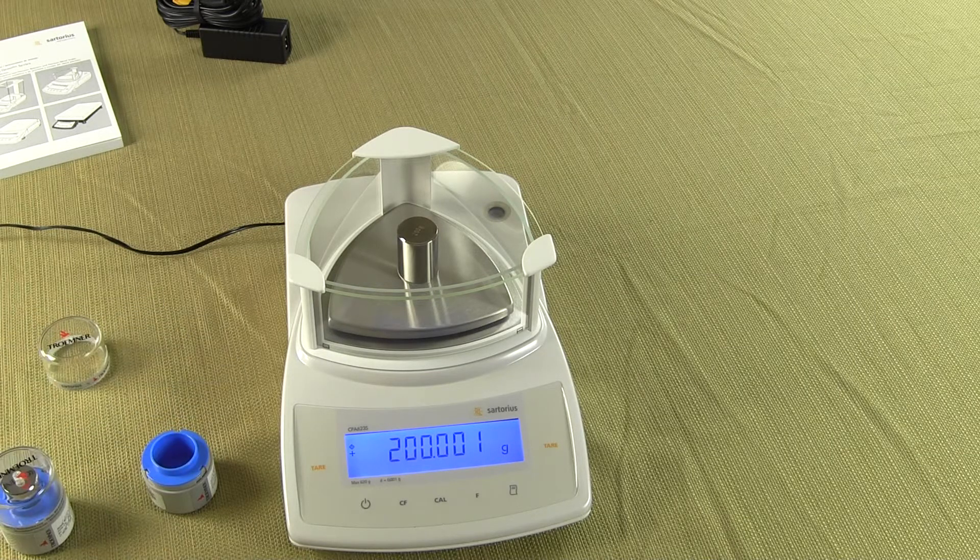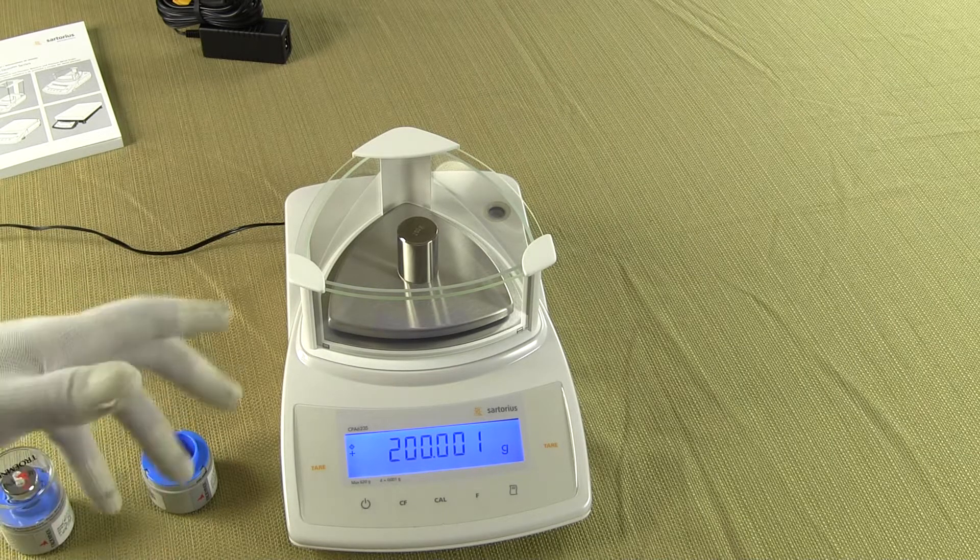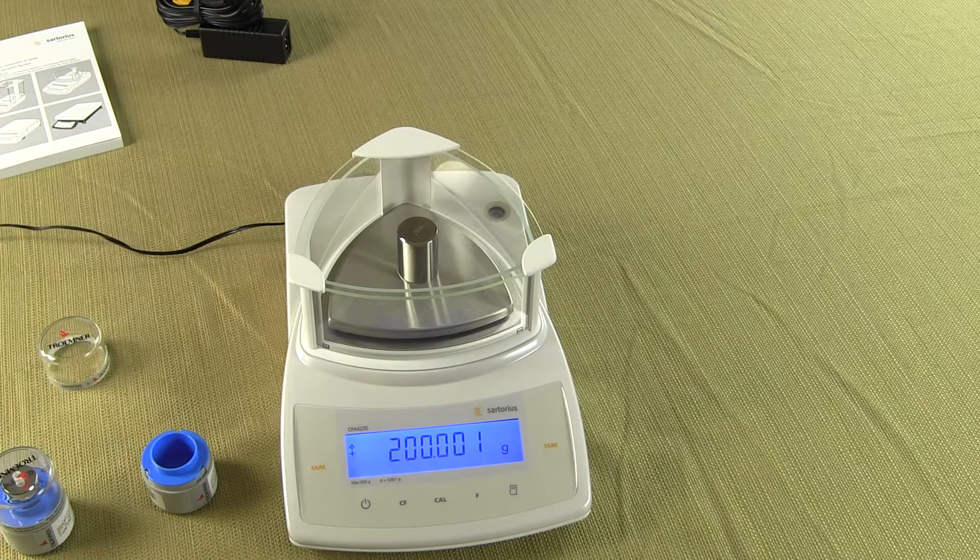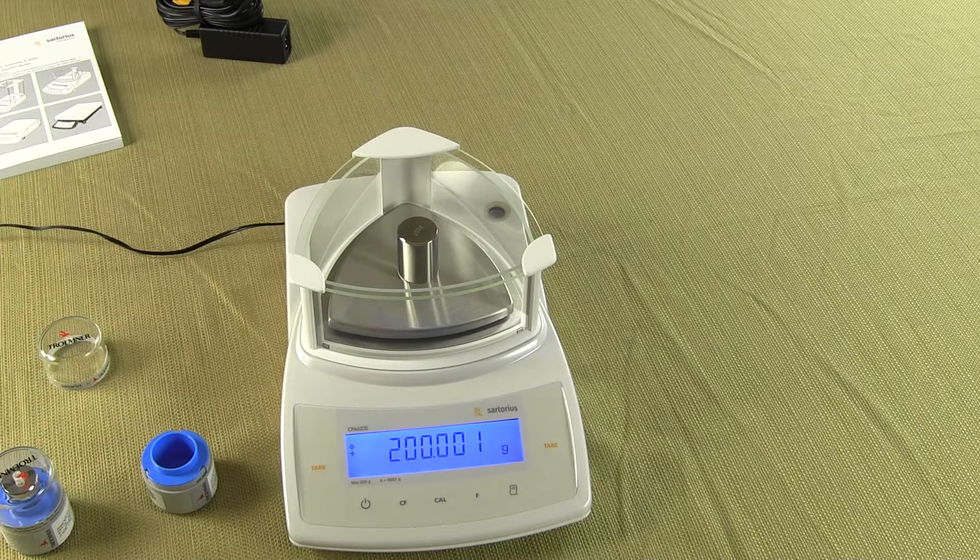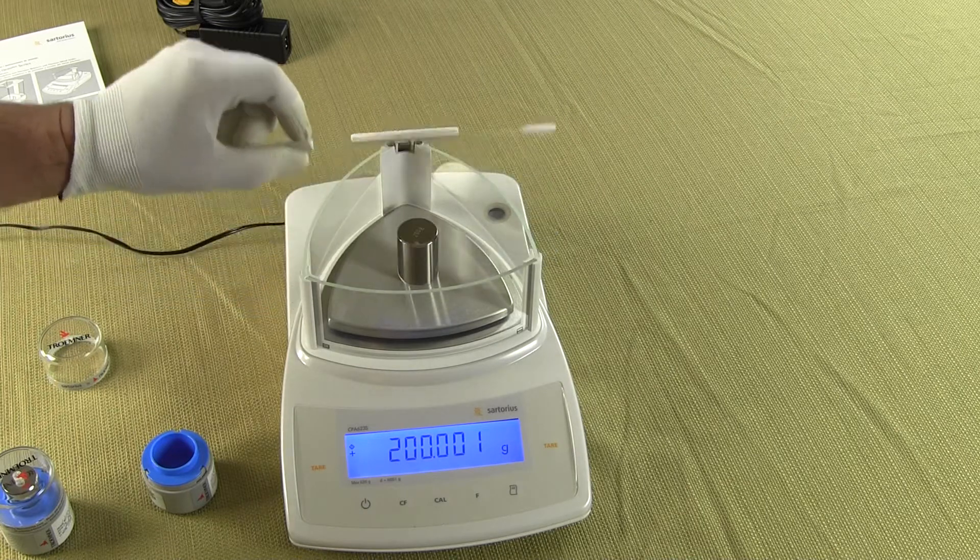And you can see the balance, the spec on this balance is plus or minus, it's readable to a milligram plus or minus two milligrams. So the balance is right on the money.